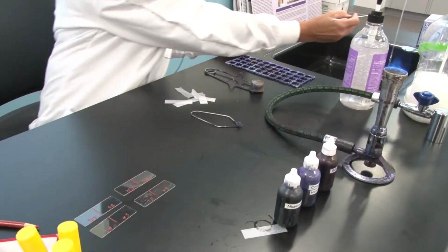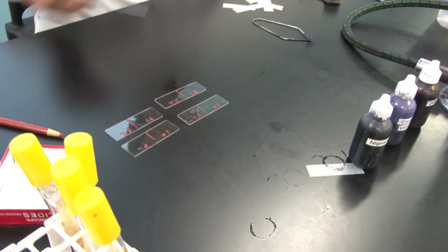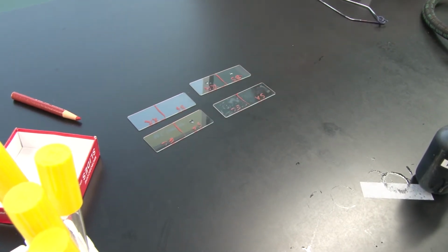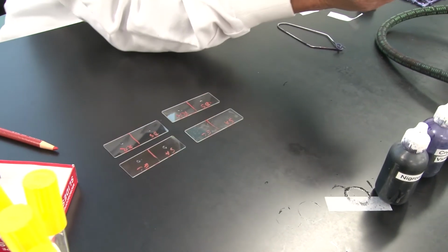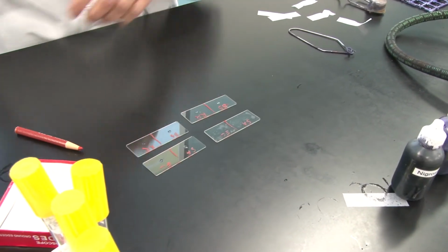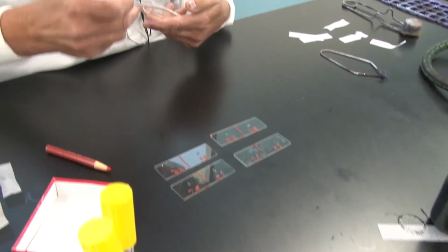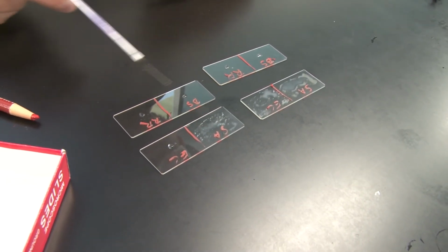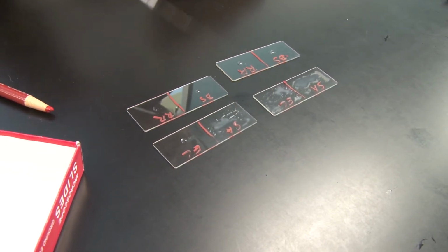I'm going to go ahead and I'm going to put drops now on all of my slides. I'm going to make the smears for both the crystal violet set of simple basic stains and for the safranin set. So a loop full dropped on each half is all we need. The reason I use a loop and not a dropper is that one of the biggest mistakes students make is they put too much water on the slide to begin with. And then the problem they have is that it takes forever to dry, and you have to allow your smears to dry before you can heat fix them, and they have to air dry, and that can take quite a long time. So I'm spreading our cells out here.